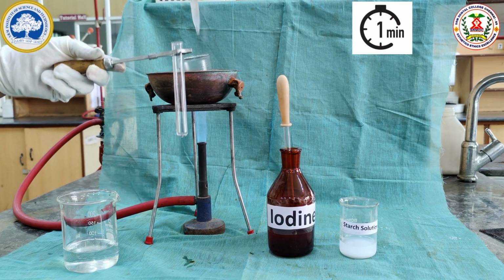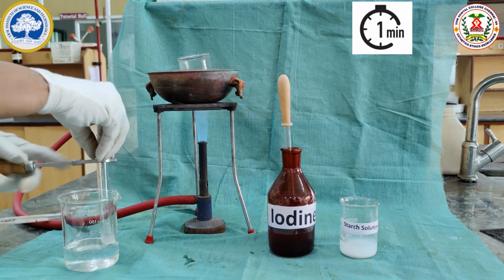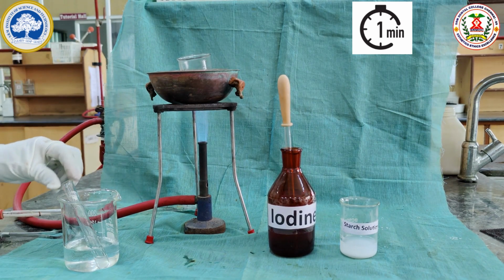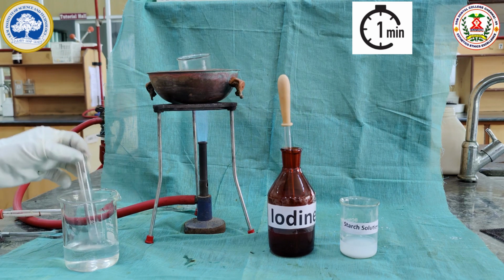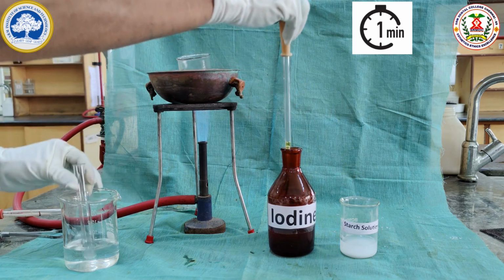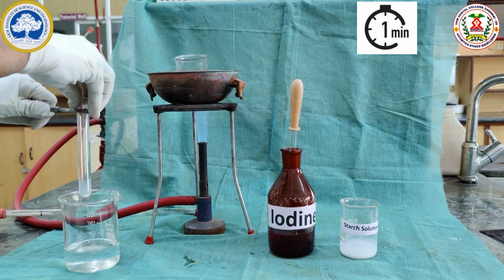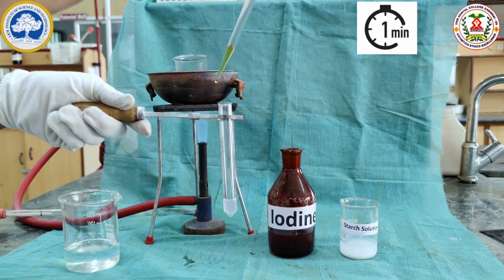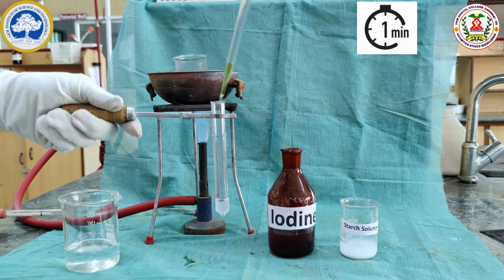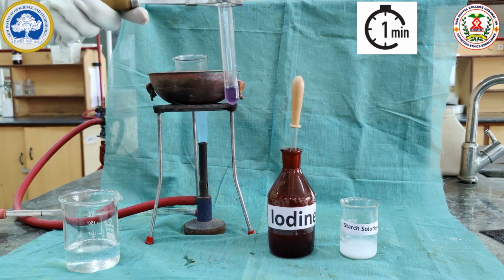2 ml of the sample is taken, cooled well, and iodine test is done. So this is the soluble starch stage. With the iodine solution, it gives an intense blue color. After cooling down, the soluble starch sample is taken and iodine test is done. For the iodine test, we are taking this 2 ml of the sample and 2 drops of the iodine. We can see the presence of blue color, but the solution is clear.